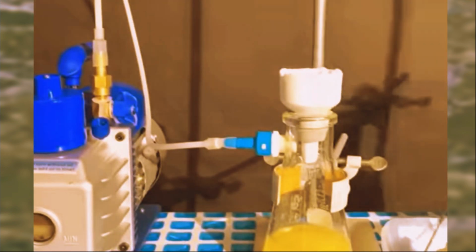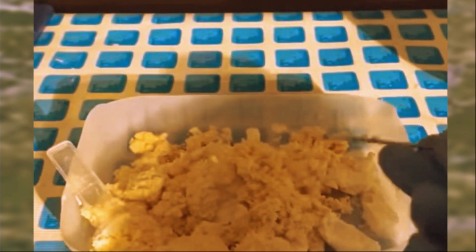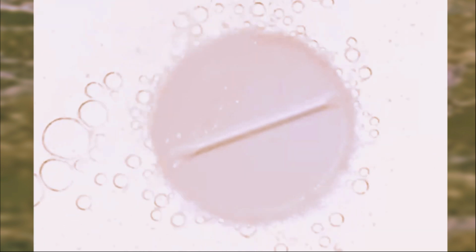If a batch passes this test with flying colors, it gets the green light for becoming tablets or capsules. But they also do random checks on each batch just to be extra sure every single one has the correct dose. The scientists compare the results to super strict standards, and if anything falls outside those lines, they investigate further.